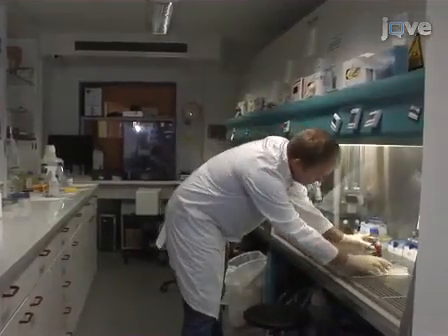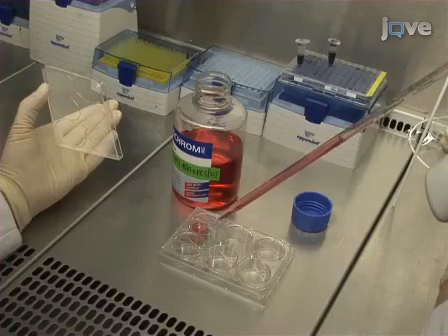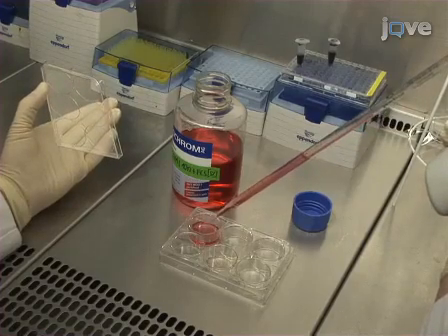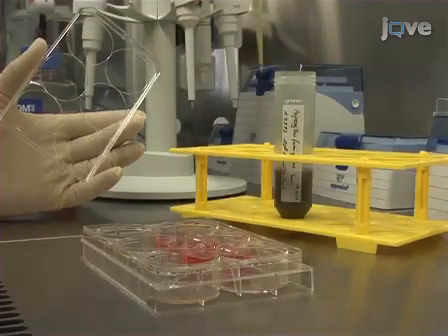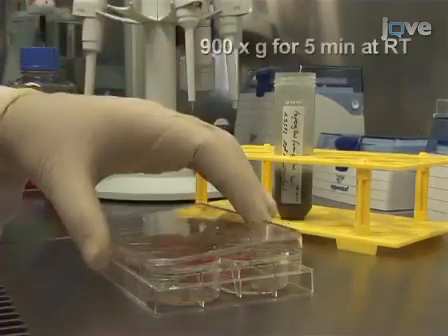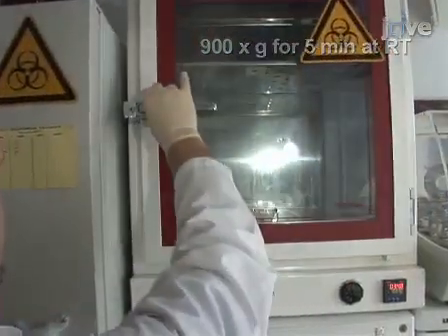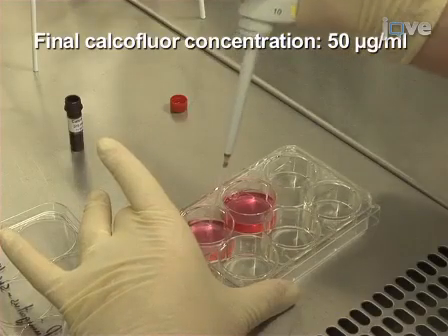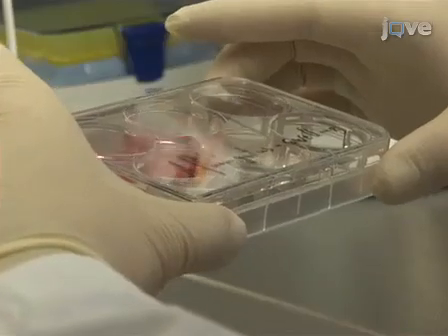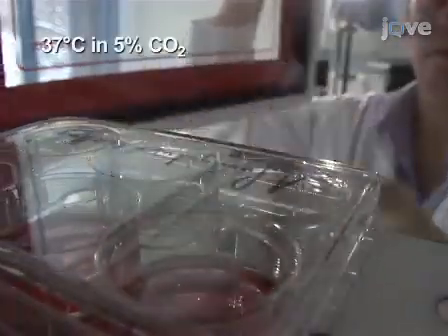To generate swollen conidia of the environmental mold Aspergillus fumigatus, add 5 ml of medium to a 6-well cell culture plate. Then, transfer 2 × 10⁷ resting conidia to the plate and incubate the spores for 7 hours at 37 degrees Celsius in 5% carbon dioxide in a BSL-2 facility. After the swelling period, fluorescently label the spores by adding 10 microliters of calcofluor white stock solution to each well. Following gentle mixing, incubate the plate for an additional 15 minutes under the same conditions.